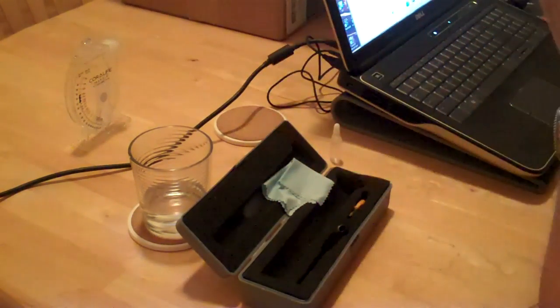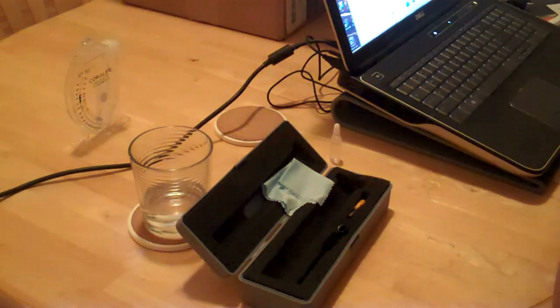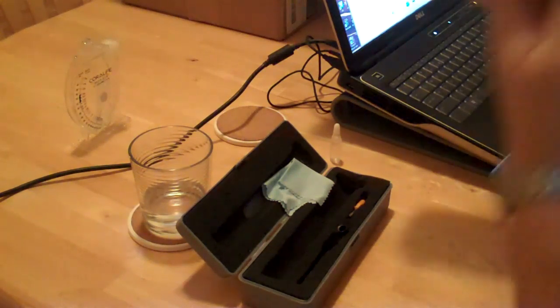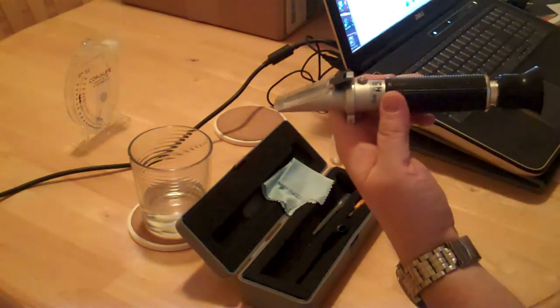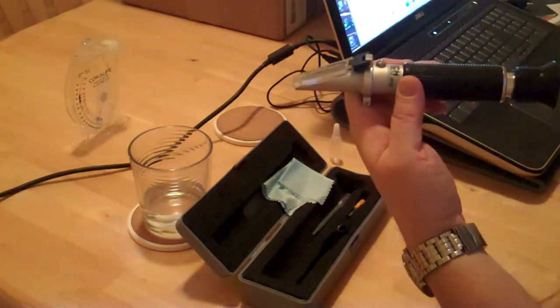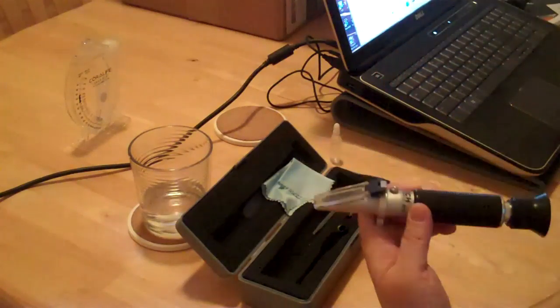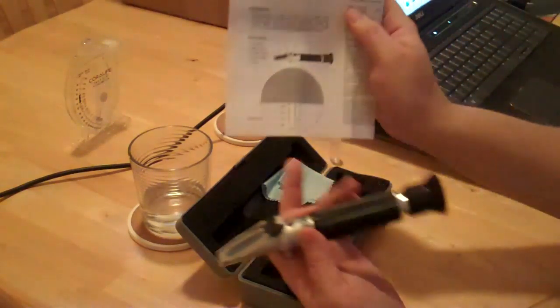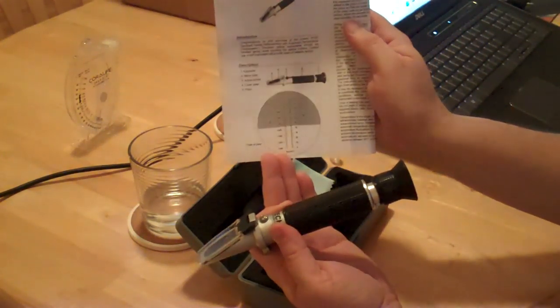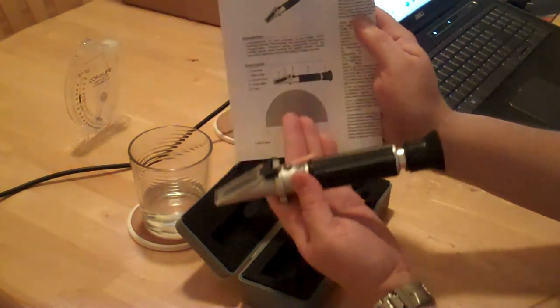You look in here and it's going to have a line. It's going to be blue all the way down to zero. You turn this screw until it hits zero. It kind of looks like this.